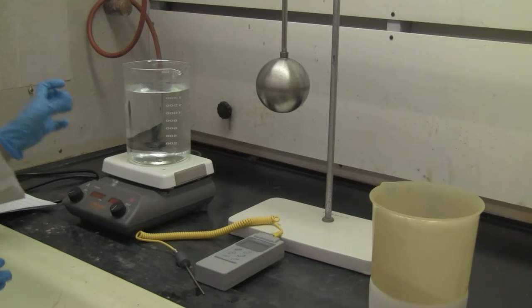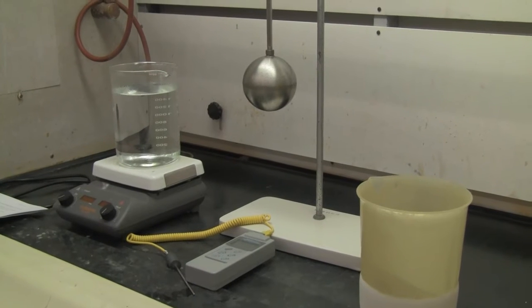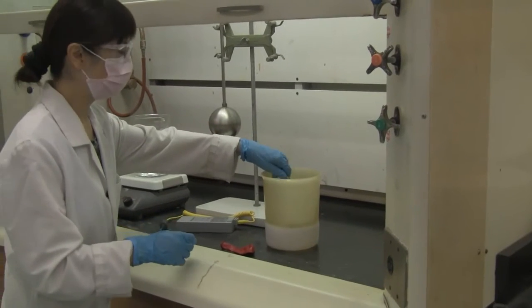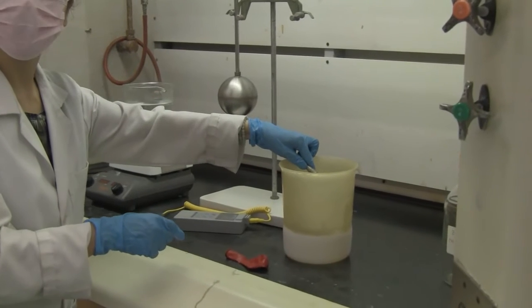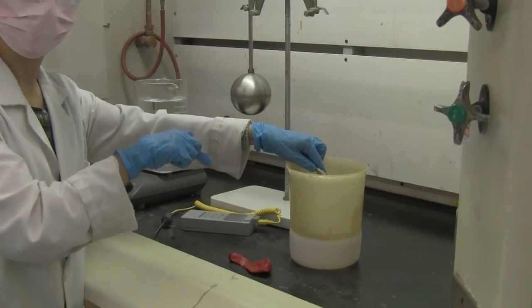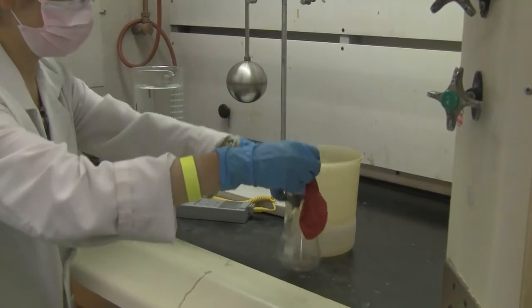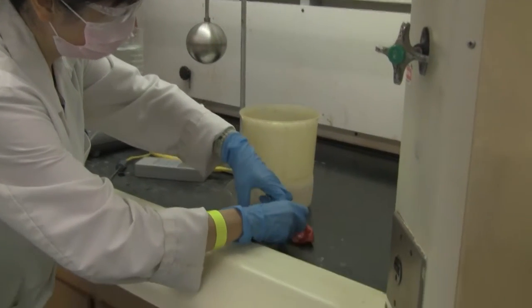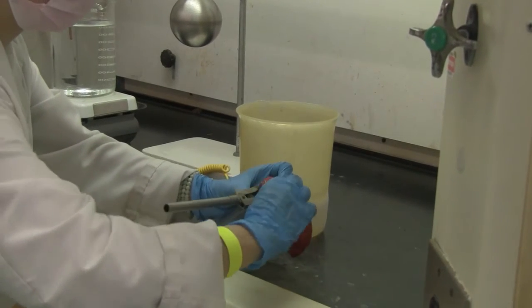This is almost boiling water. Okay, now I put this flask into the cold tank. So I will cool the air inside. Then I will use a balloon to trap the air inside. So I'm going to take this out. It's quite cold now. I'm going to put the balloon on the top of it. Let's trap the air in.